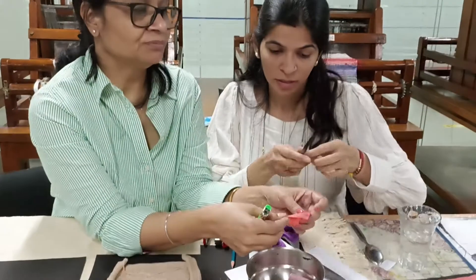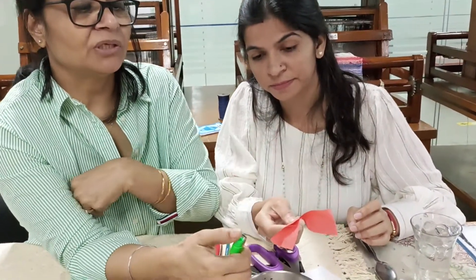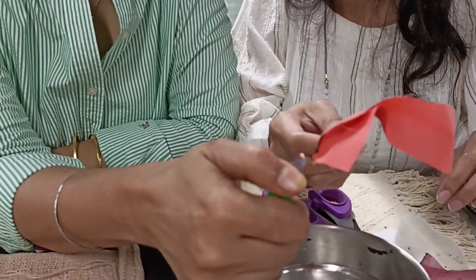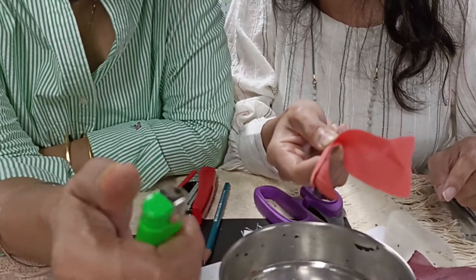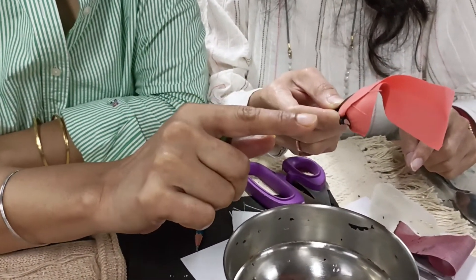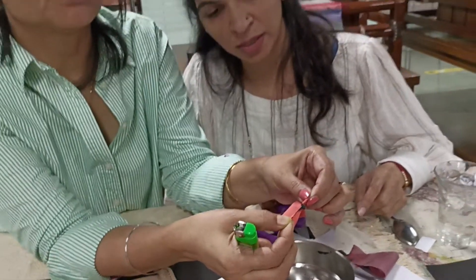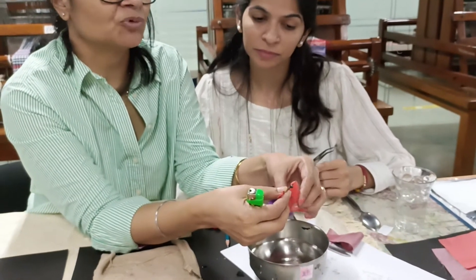Next is 100% polyester. Be very careful while burning this also, because it is also going to melt. It starts melting and forms a black smoke. See how it catches fire and starts dripping down — the polymer will start dripping down. It forms like a plastic substance and melts like polythene, then hardens. It's very hot right now so we can't touch it immediately.